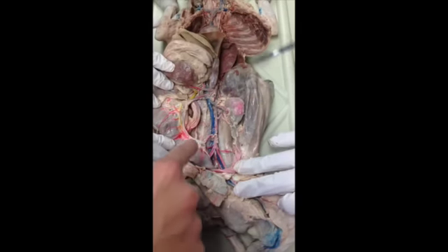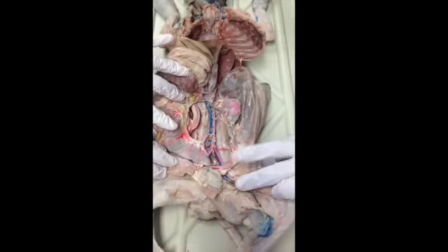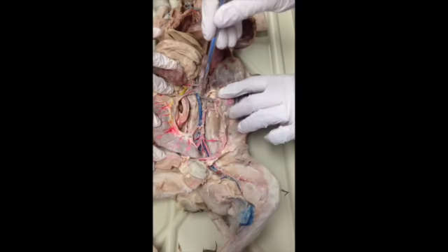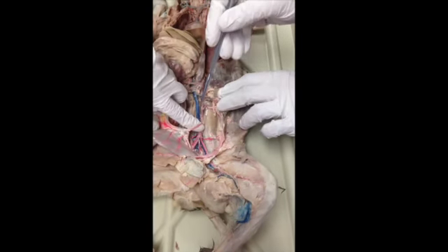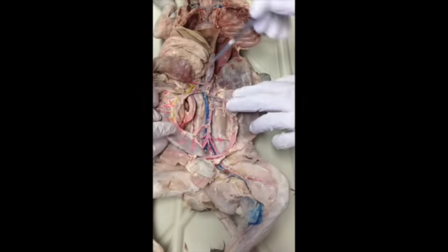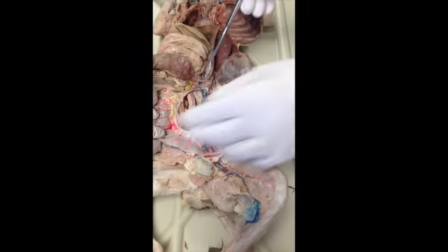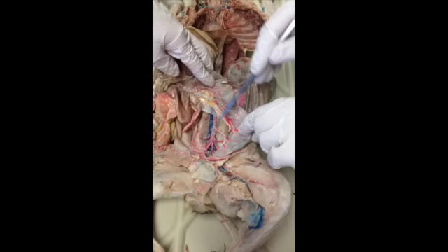And is that the same with the human? We have a common, and the cat does not. I was talking about the mesenteric. Oh, the inferior mesenteric artery? That's the same as humans. It goes to the colon, right? Yeah, it does. So their functions are the same, and if we put the colon in its right place, it would even be in the same orientation.